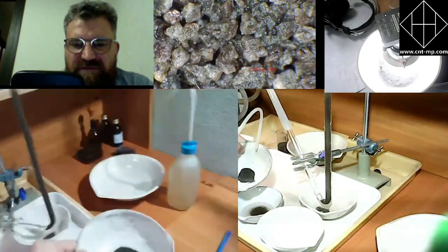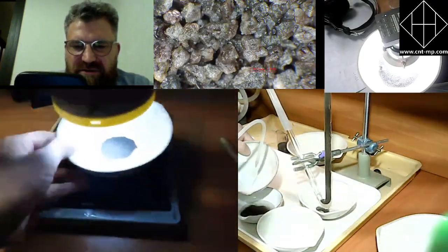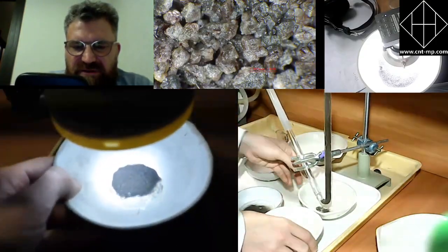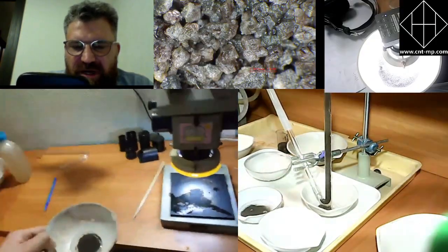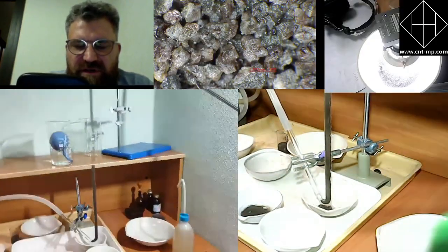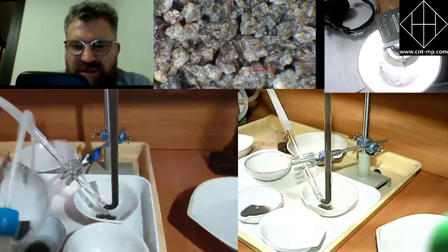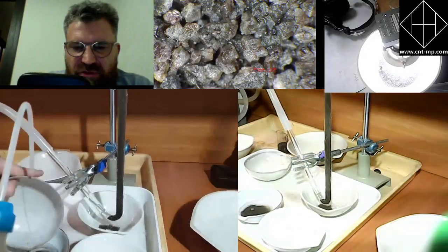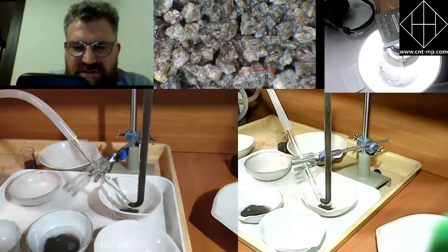They're just switching one and the other dishes. It's all the same product. They are doing it for the first time. That's why they monitor every amount of sample fraction that is going out of the tube, to make sure that they are not losing any sulfide grain. Then they reunite that material together because it's all the same material.